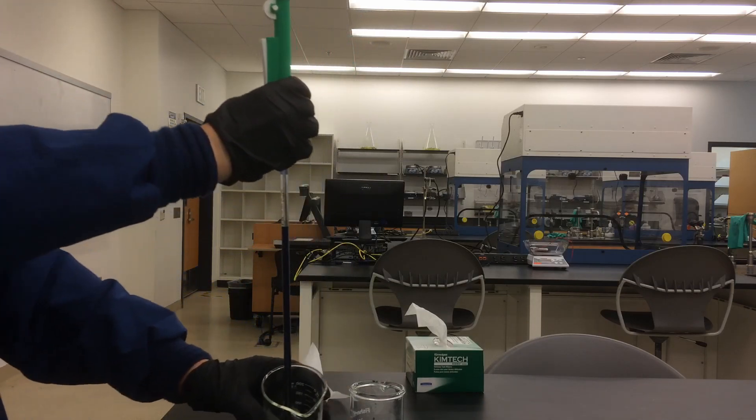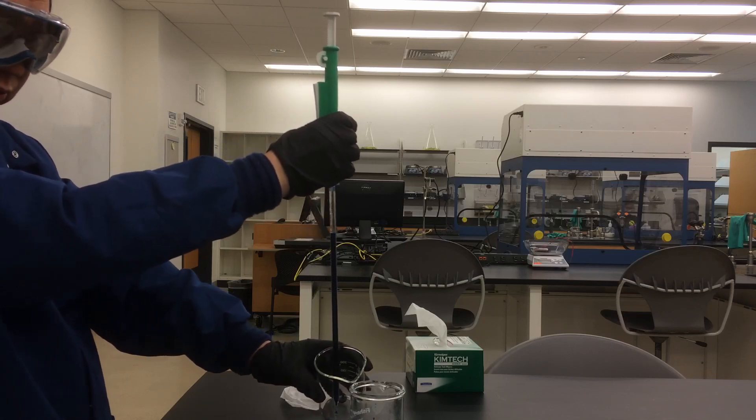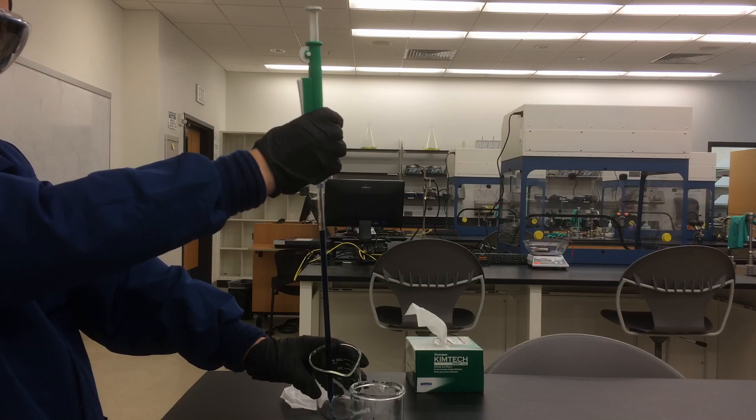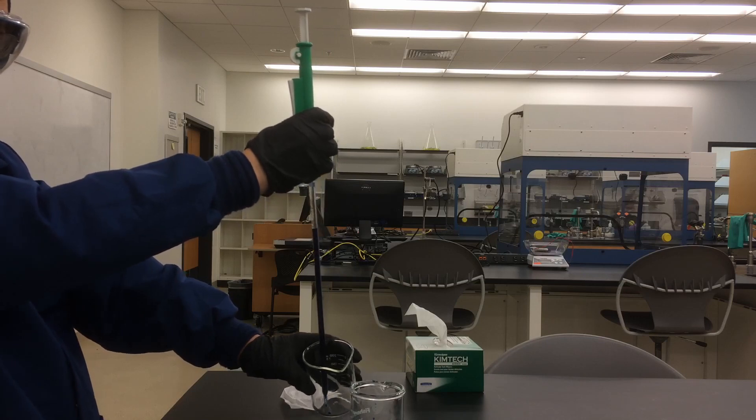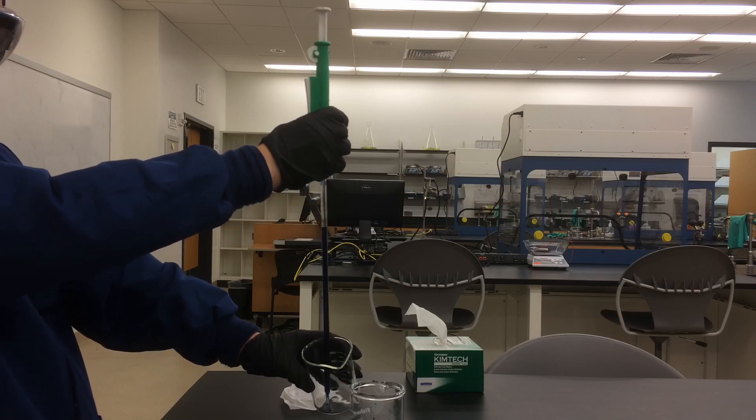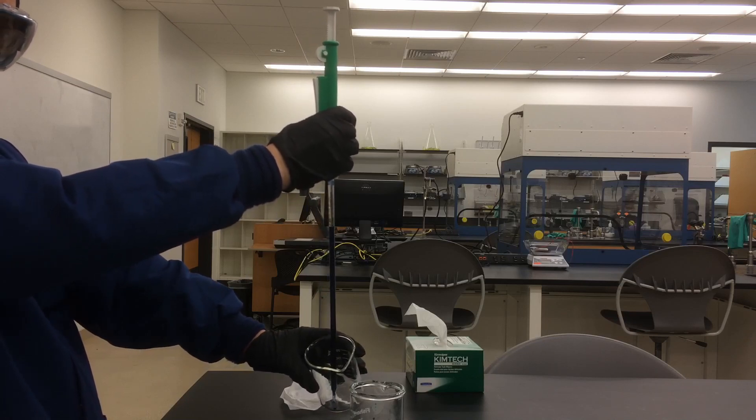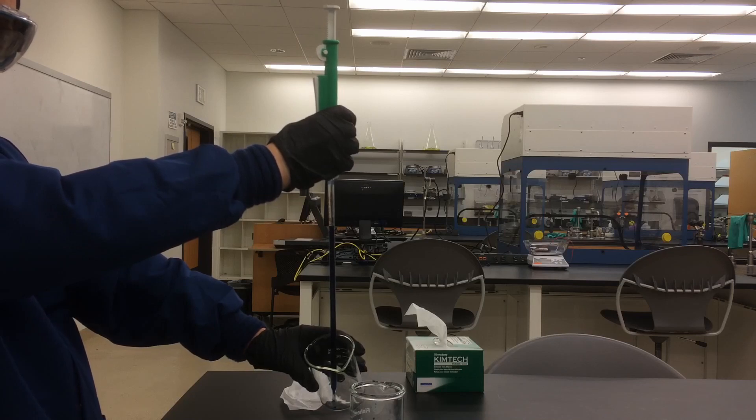Third, transfer the solution. Let's say you want to transfer four milliliters of solution. Hold the pipette over the receiving beaker. Touch the tip of the pipette to the inside of the beaker.